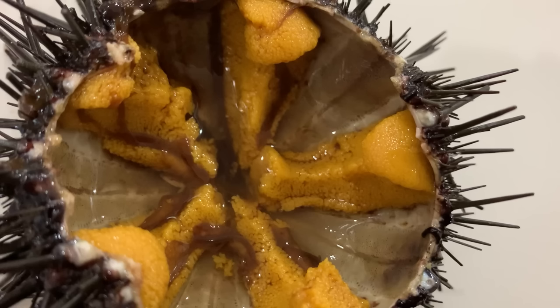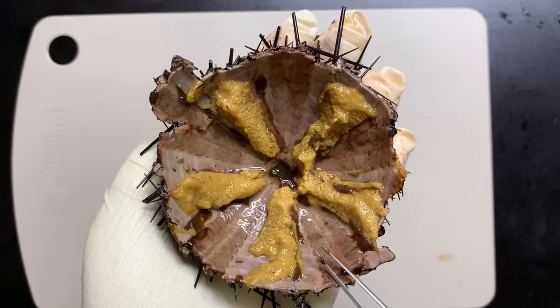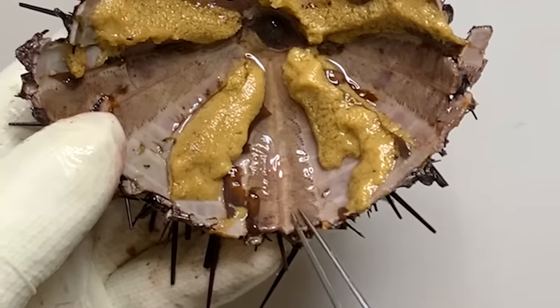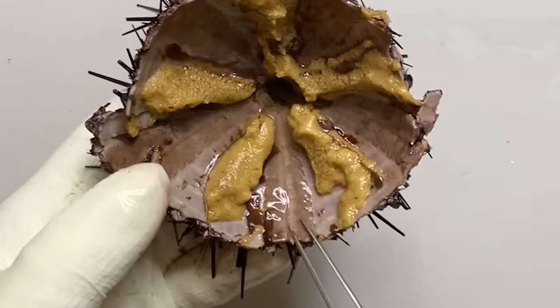This yellow-colored part is called sea urchin roe and is often used as a food ingredient. These are the gonads of sea urchins — they have 5 gonads. And between the gonads, you can also see the 5 ambulacral zones from which the tube feet come out.